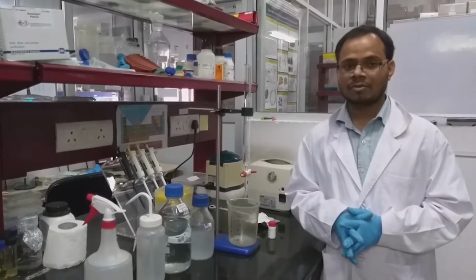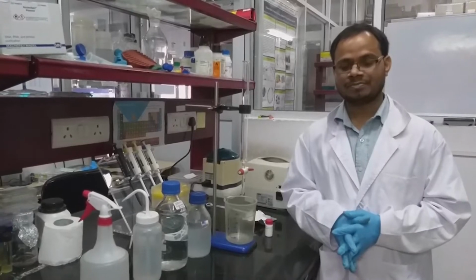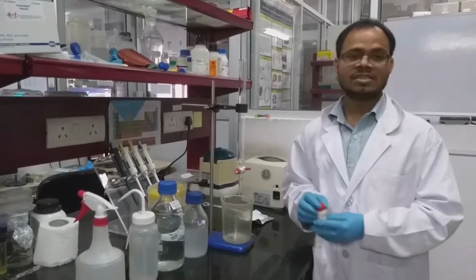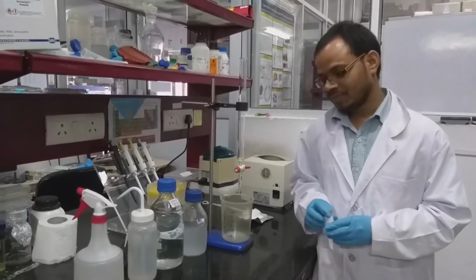Or we can use agarose, which is also cross-linked, or polyacrylamide. But in this video, we are showing Sephadex G75. This is the stationary phase we are using.